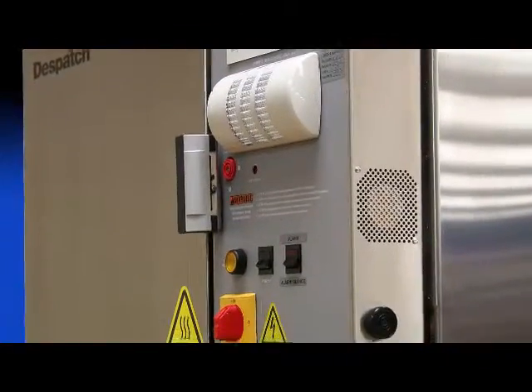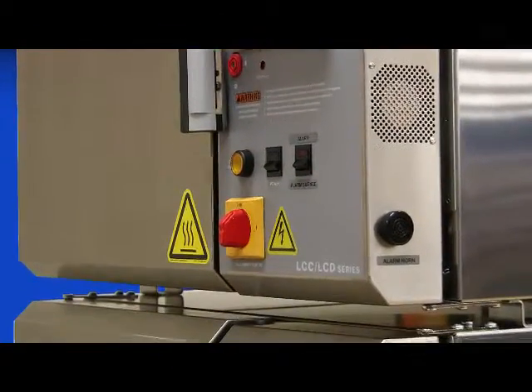Before beginning, disconnect power from the oven and make sure lockout and tagout procedures are in place.